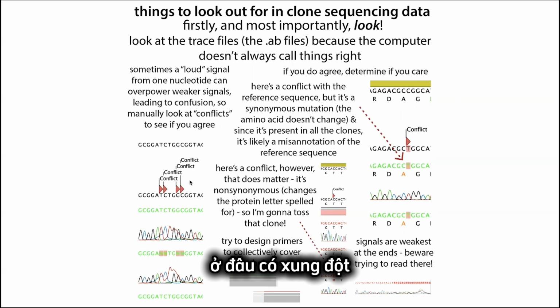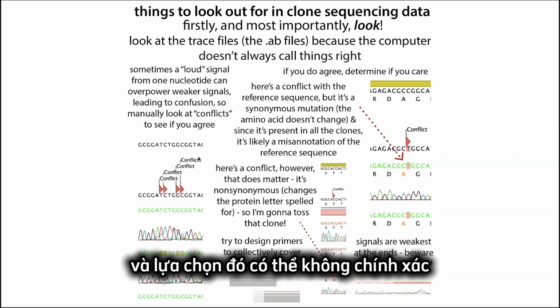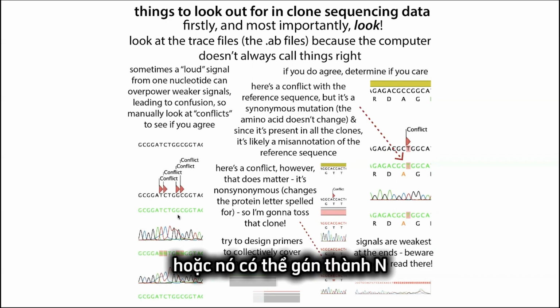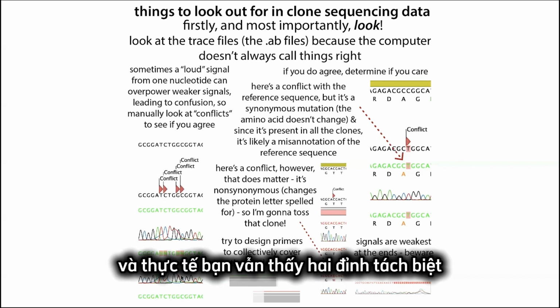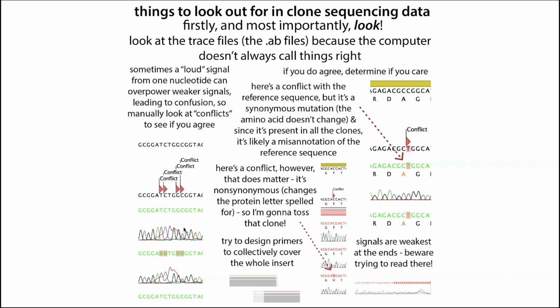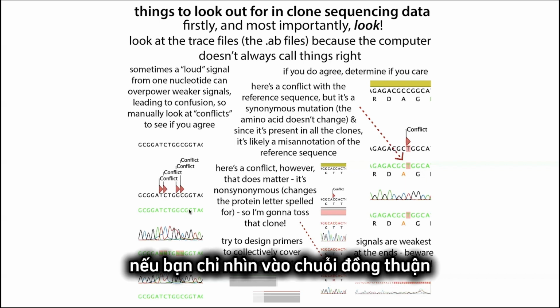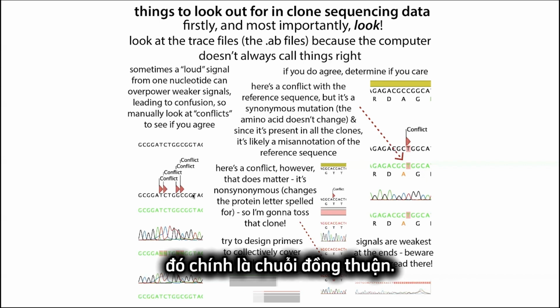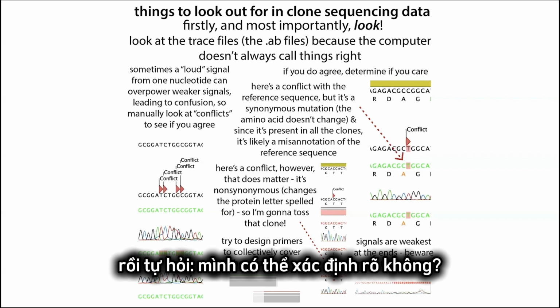And so the software will often tell you where there are conflicts, or it'll just call it wrong. It'll make a choice, and this might not actually be the right choice, or it might put an N where you can go and look at it and see, oh, that's clearly just because you have these 2 G's right next to each other. You can see that you actually do see 2 separate peaks, and it is GG. So your eyes can tell more than the software can sometimes. If you were to just look at the consensus sequence, which is what that sequence file would give you, it would have those N's, or those X's, or those wrong letters. And so it's important that you go and look at the data directly, go to those conflict sites and see, okay, can I figure this out?